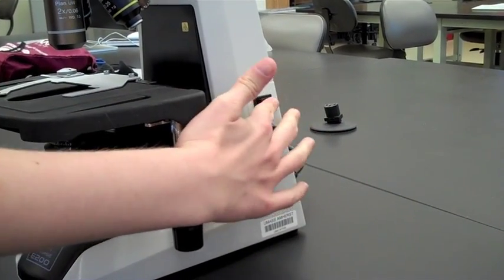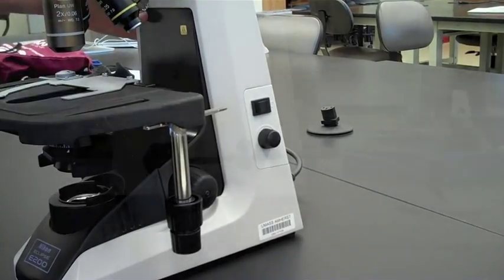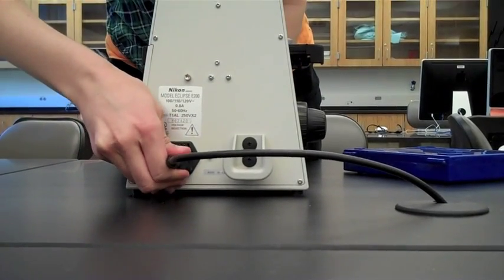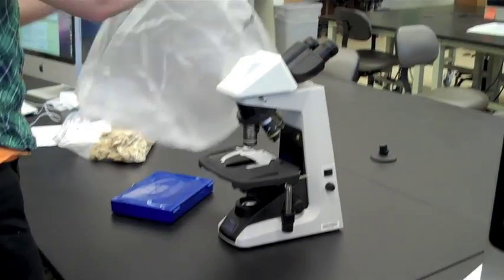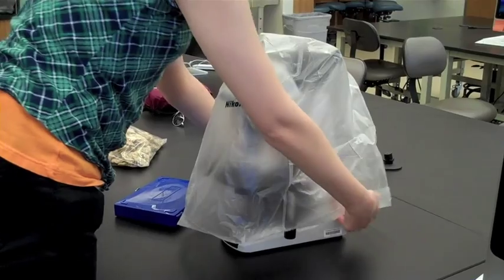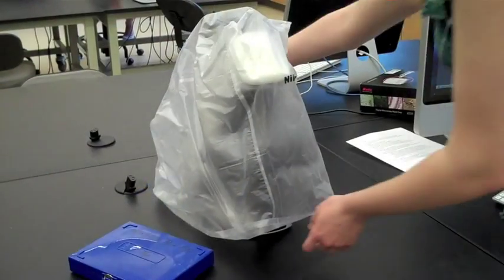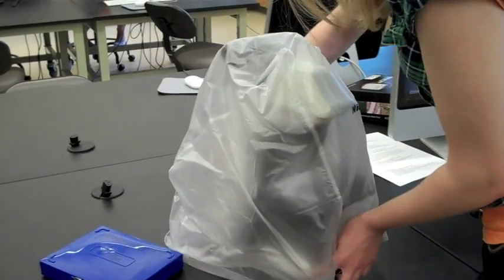Turn off the lamp. Unplug the microscope. Put the cover back on. And carefully carry it back to the cabinet.